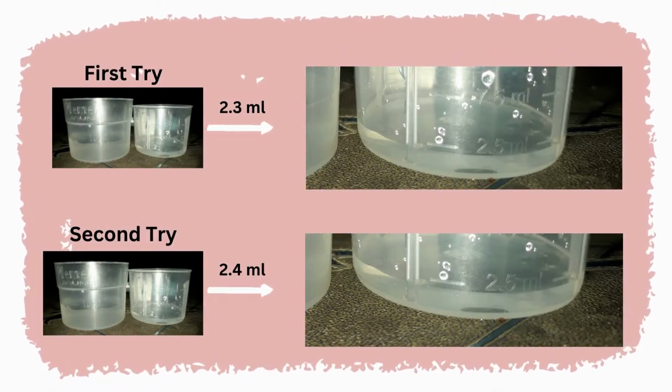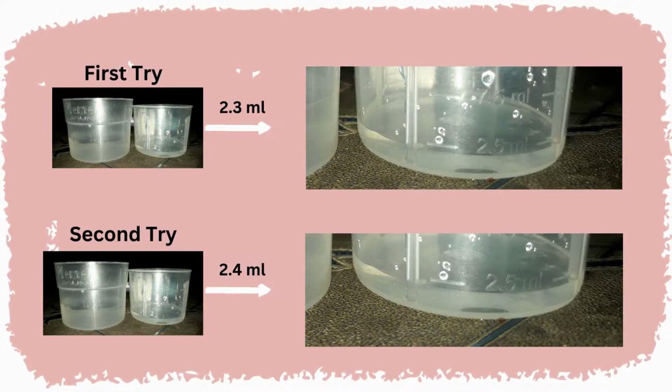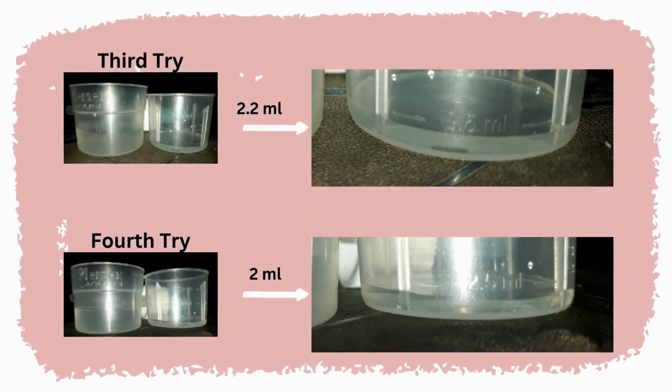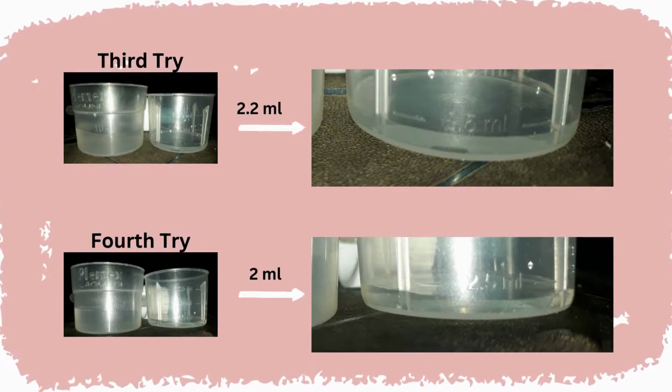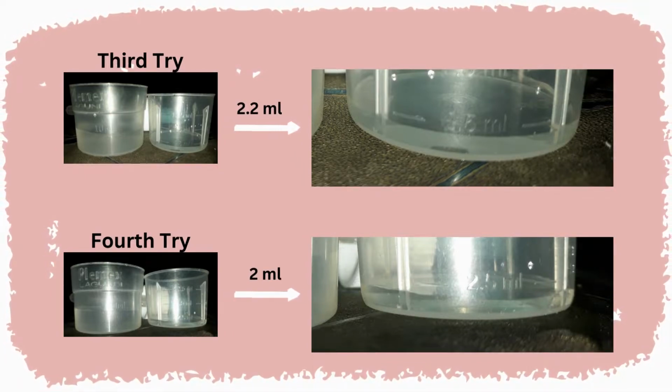So, as you can see, on my first try it exceeds 2 ml, which is 2.3. So was my second try. And here in my third try, I almost got 2 ml, but in my fourth try, I finally estimated 2 ml. So it took me 4 tries until I estimated it correctly.